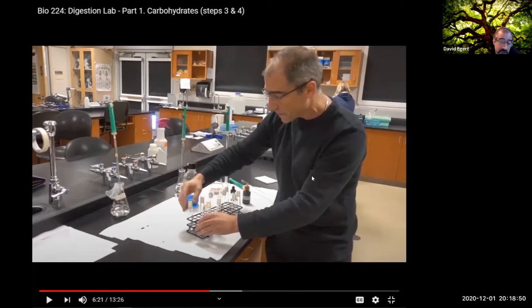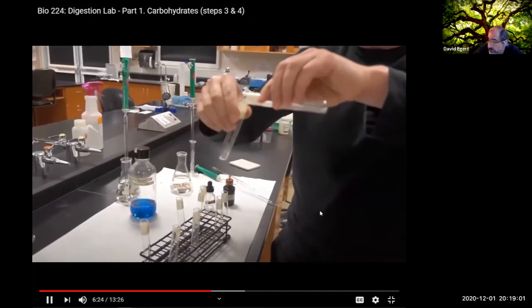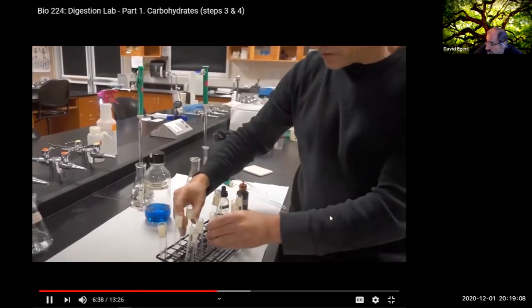So we're splitting each of them. For each tube, we're going to be able to look for maltose and look for starch using these 2 different techniques. And again, it doesn't matter exactly, just roughly equal. And these are my 3 experimental tubes here. And then remember, I also have the control tubes here.